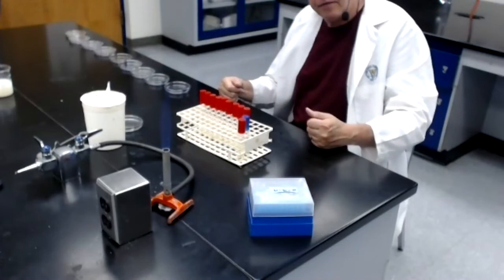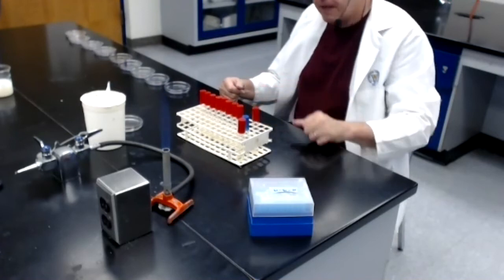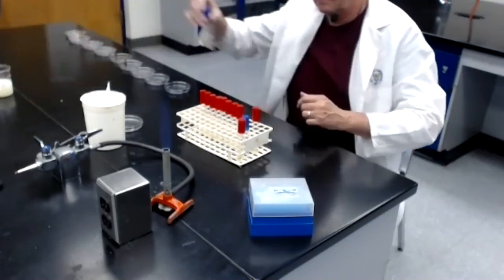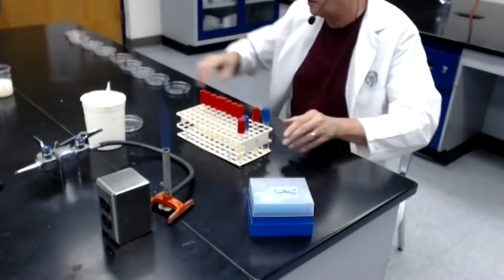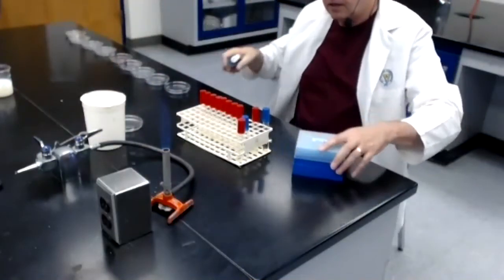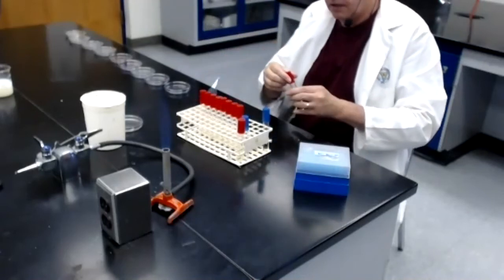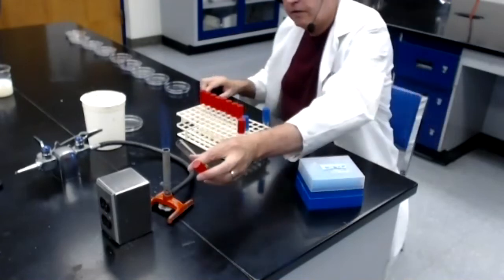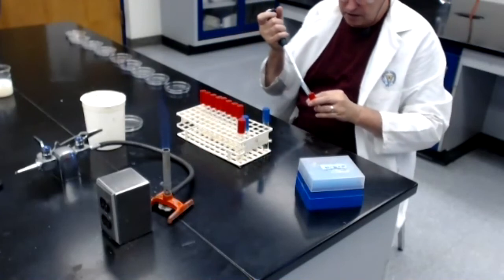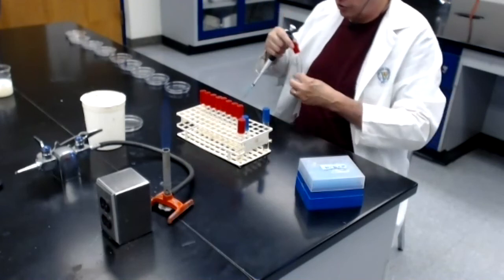Let's repeat that for dilution tube number 2. Dilution tube number 2 is a 1/100th dilution. I'm ready to go. I'm going to grab a tube of melted agar, put it in the rack, grab a micropipetter. I need to move quickly. Get a pipette tip. Grab dilution tube number 2. Make sure it's mixed. Pop the top. Flame the mouth. Take the fresh tip I have here. Pull the trigger, and withdraw 1 mil of dilution tube number 2.